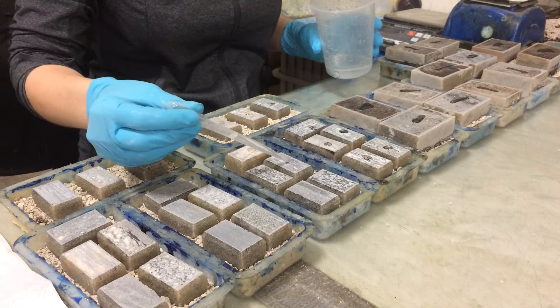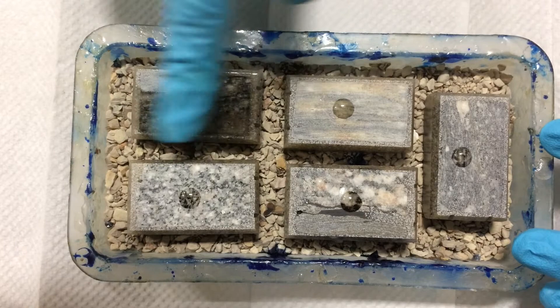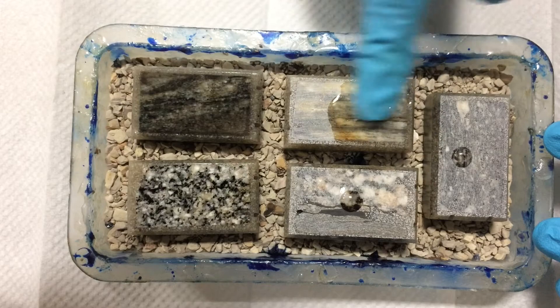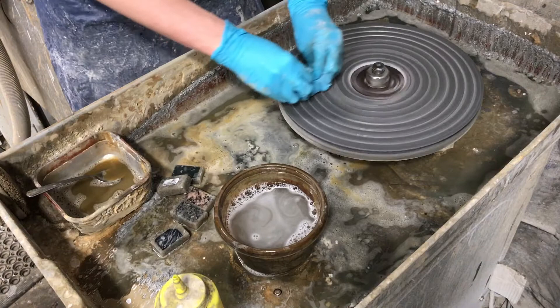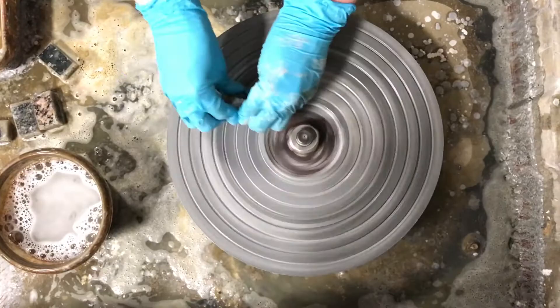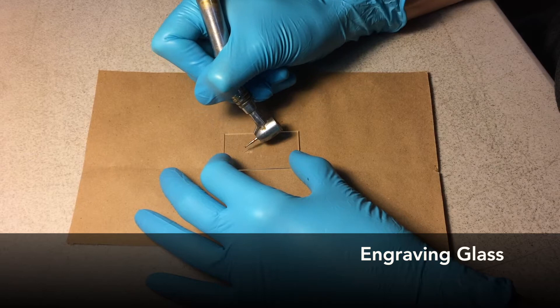At this point, most samples benefit from a stabilization step called surface impregnation. When the billets are again dry, a layer of resin is applied to their exposed surfaces. This resin fills any voids or cracks, penetrates water-sensitive materials, and locks out any possible contaminants. After another overnight curing period, surface preparation continues — surplus resin is removed by a fine diamond cloth. Then the final target surface is prepared on the mud wheel, where an 18-micron free abrasive removes any defects remaining from prior surfacing steps and creates a smooth matte surface that will then be mounted to the glass.